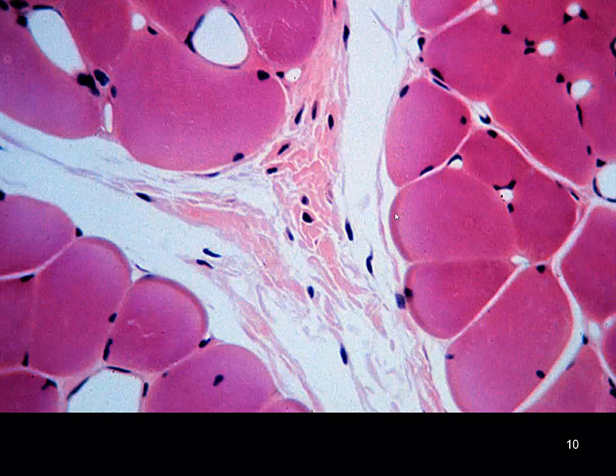So here, a little bit more close look. This is going to be our perimysium. We've got some fibroblastic cells running through here, collagen fibers. Between our muscle cells, this is going to be our endomysium. Got some capillaries in here. Again, notice the peripheral nuclei, and that will always lead you down the straight and narrow. You won't get this confused with either cardiac or smooth because those nuclei are centrally located.